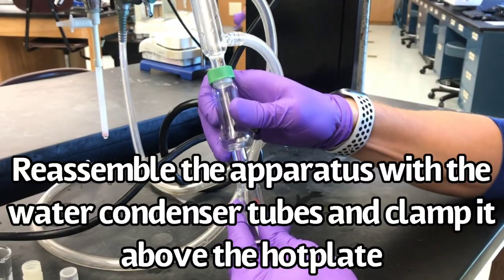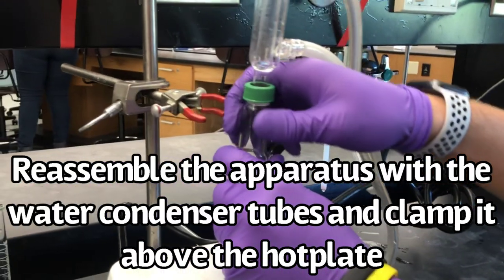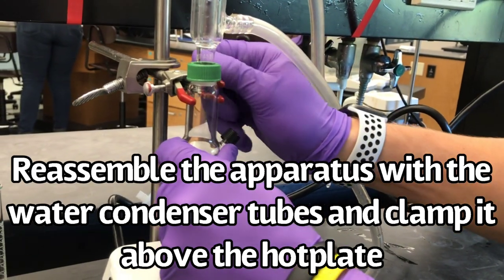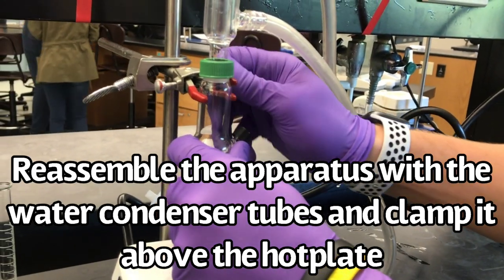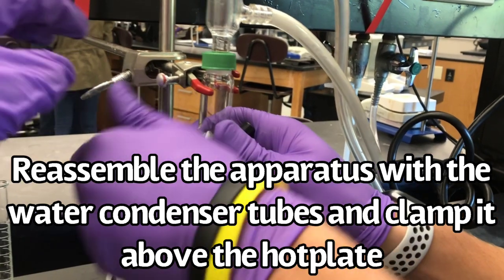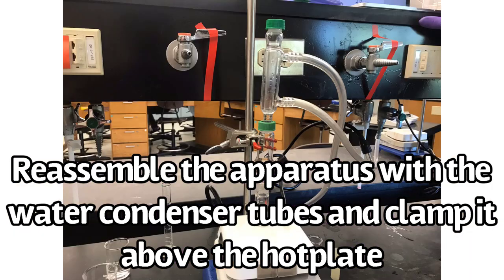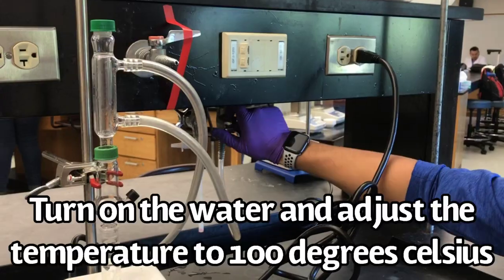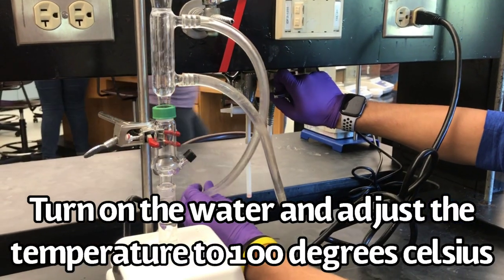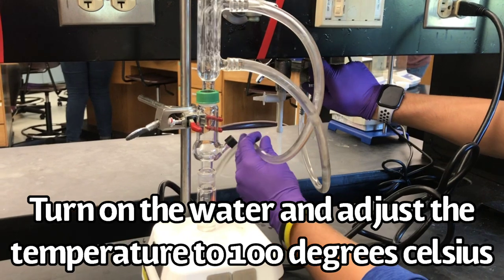Reassemble the apparatus, attach the water condenser in and out tubes, and clamp the apparatus above the hot plate. Turn on the water and adjust the temperature of the hot plate to 100 degrees Celsius.